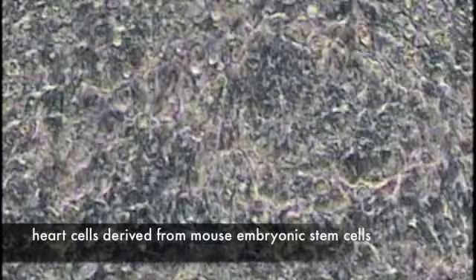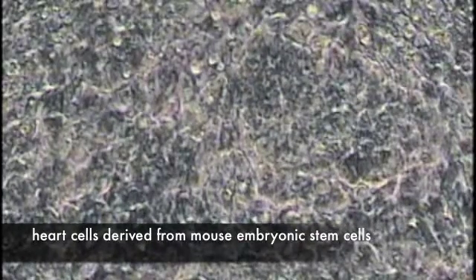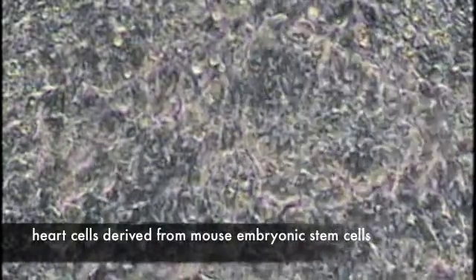Shown here is a patch of cardiac myocytes derived from mouse embryonic stem cells. As you can see, these cells form groups that communicate with one another to spontaneously contract in a synchronous wave similar to endogenous heart muscle tissue.